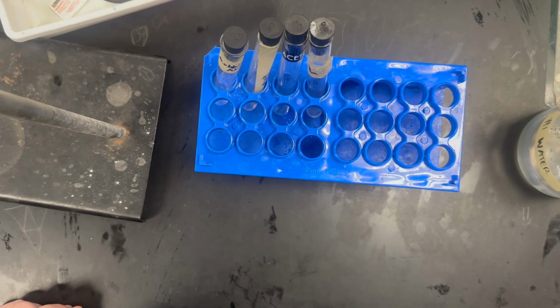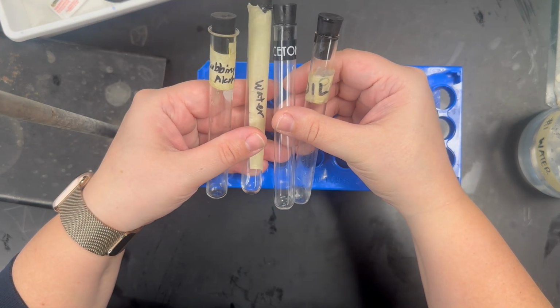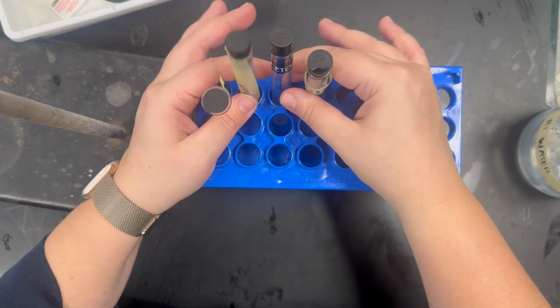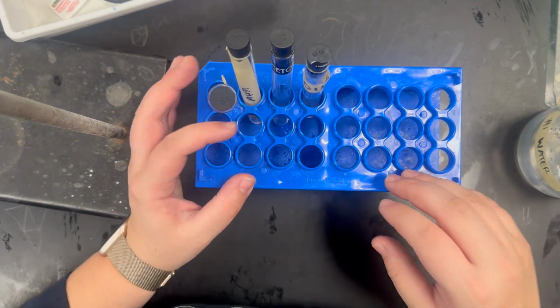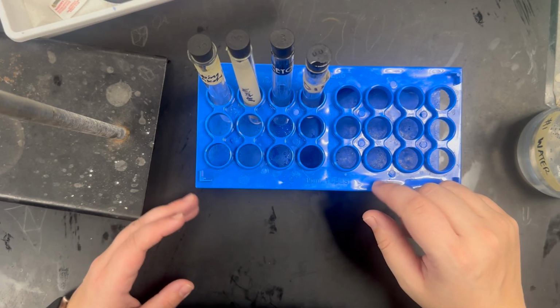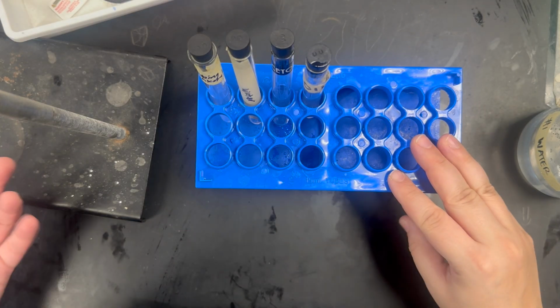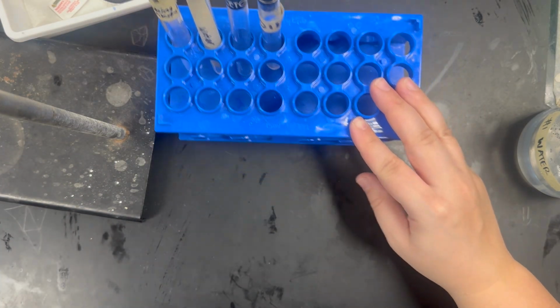Okay, welcome to your final station, station 3, can it dissolve? Again, we're working with the 4 liquids, so they should all be labeled test tubes. If at any point in any of the stations your label's falling off, just let your teacher know. We can grab more duct tape and label it. Everything should be labeled. Now, again, I'm just gonna show you one of the liquids. You're going to be doing all 4 of them.